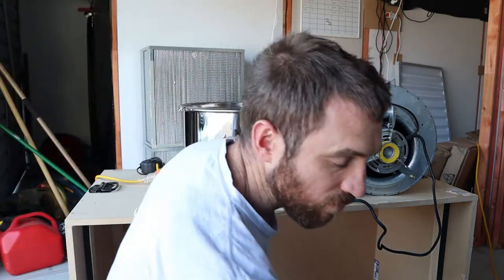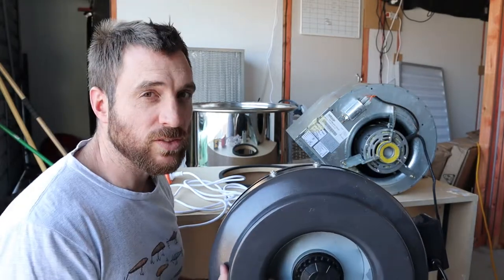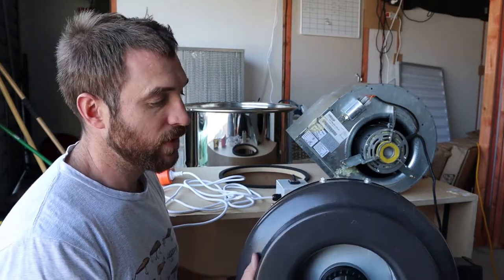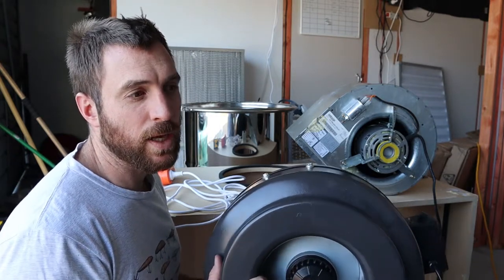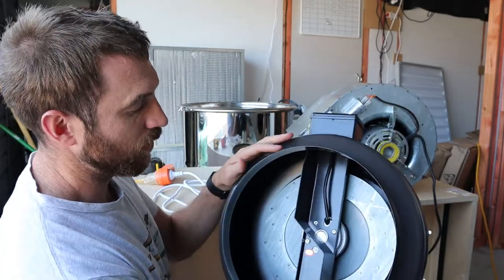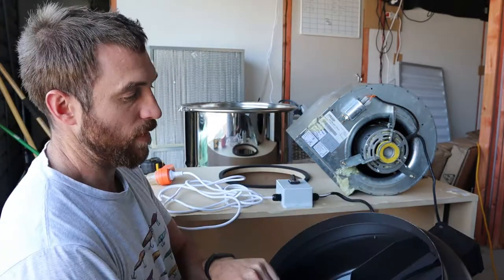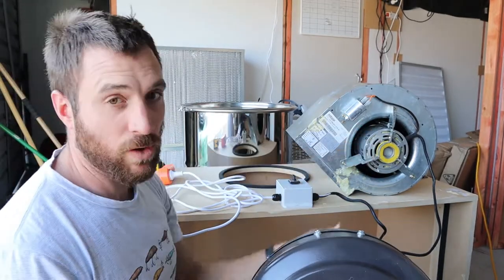The mistake was when I first got the fan, I got a centrifugal fan like this. Now, if this is all you can get, by all means use one. It does the trick, but it doesn't do it well. They pump out a huge volume of air, but they're not good once you get some back pressure in there. Obviously, how it functions is it sucks the air and pushes it sideways, which then curls it around and out. Not as good as one of these new ones I've got here, the blower type.